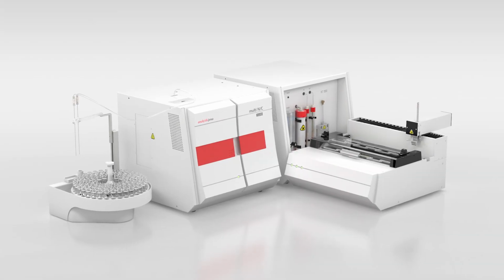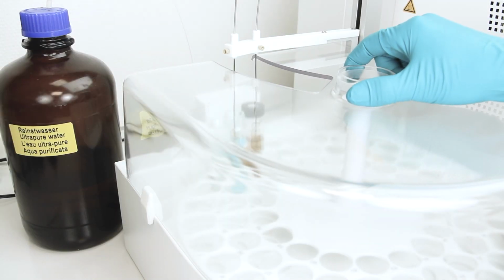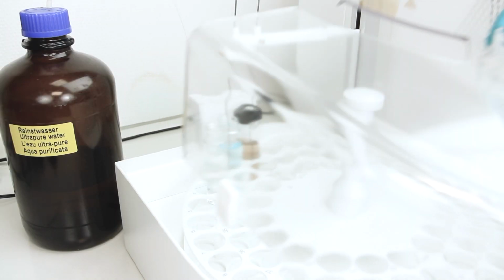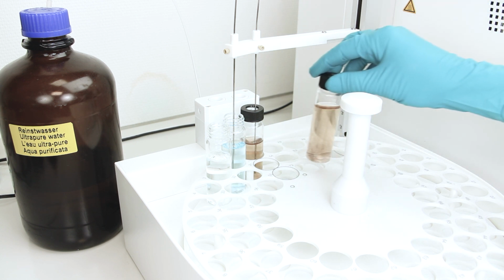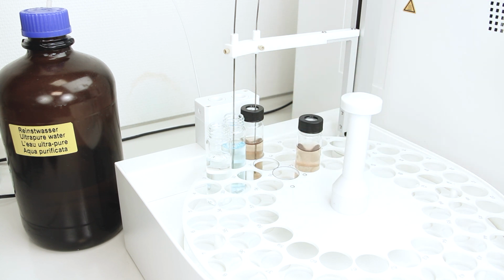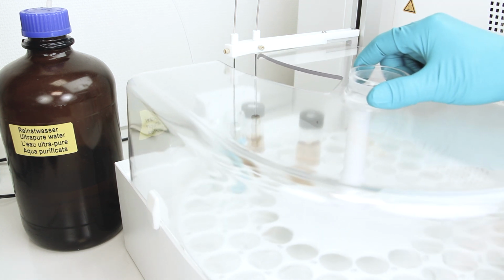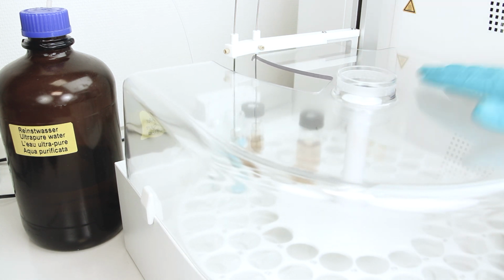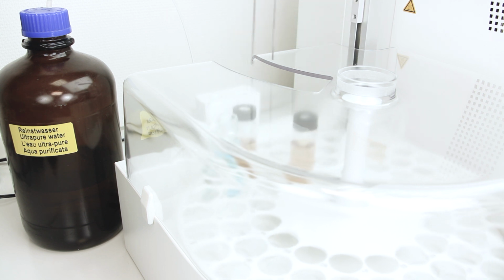DOC is determined by NPOC measurement using the multi-NC 3100 and AS Vario autosampler with external rinse function. Parallel purge and measurement for fast sample throughput is realized, and appending samples during a running measurement sequence is enabled to support flexible operation.